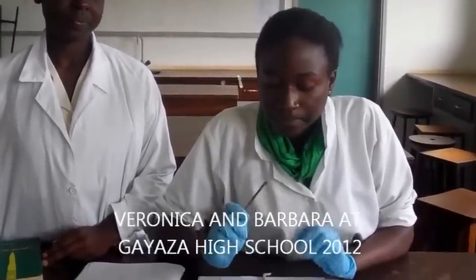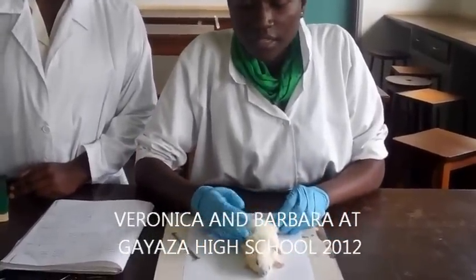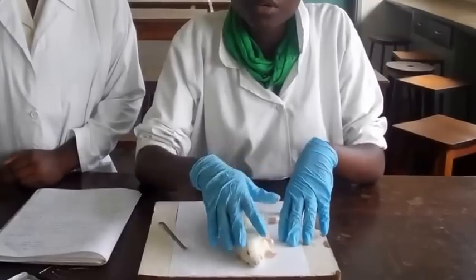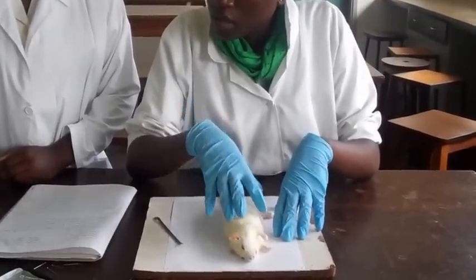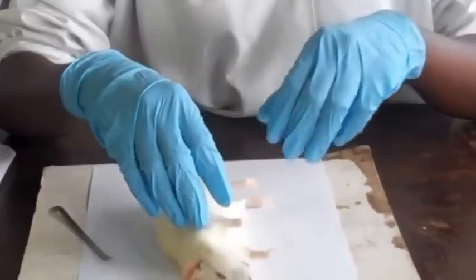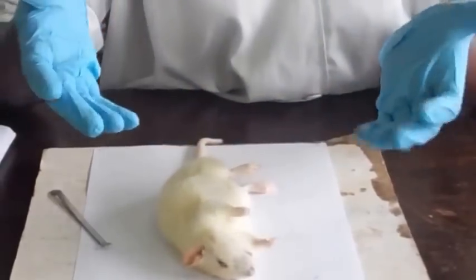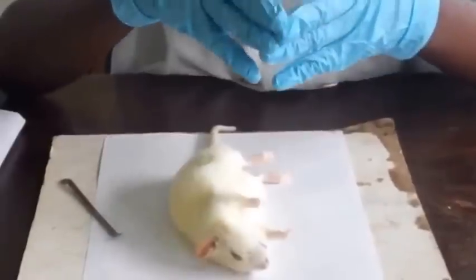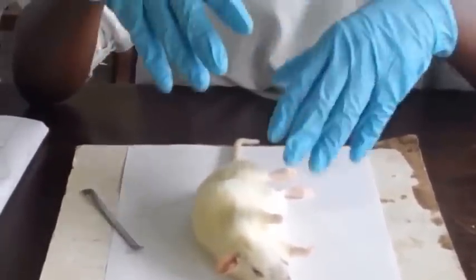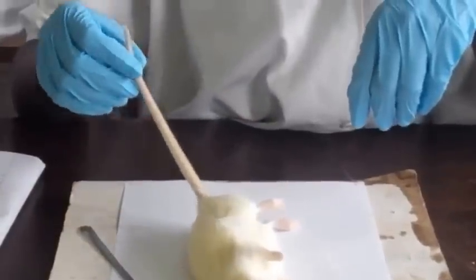Of a rat. Now, we're going to start with the external features and we're going to try to classify it depending on what we see. Classification. The rat belongs to kingdom Animalia because, as we can see, it has no chlorophyll. And then it belongs to phylum Chordata because it has a post-anal tail.